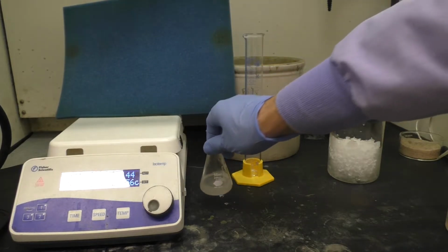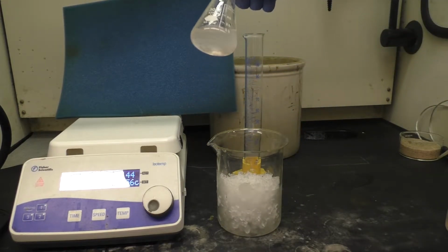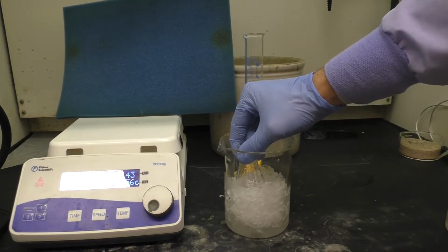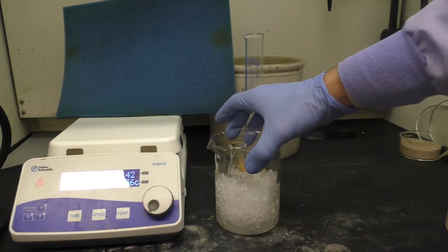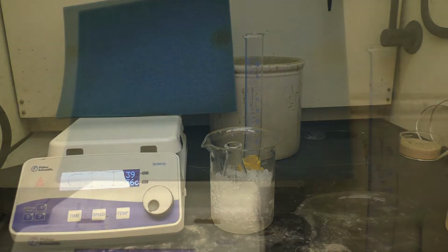So at this point, we'll take an ice bath and place our material in the ice bath and hope for it to crystallize and form solid. If we do not have any solid formed in about 15 minutes, we can take a glass stir rod and really scrape the bottom of the glass Erlenmeyer, just trying to score that surface, to provide a seeding surface for crystals to grow. And so we'll let that sit for 15 minutes and see what we get.